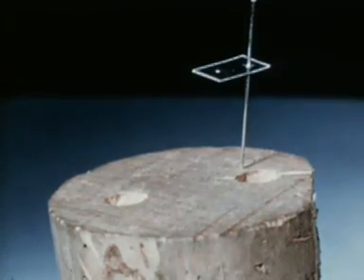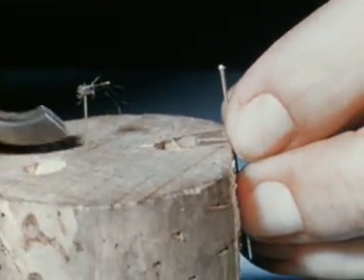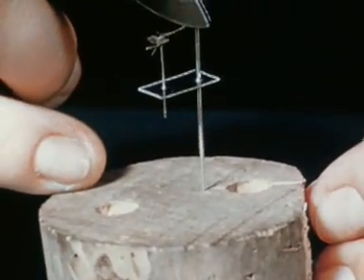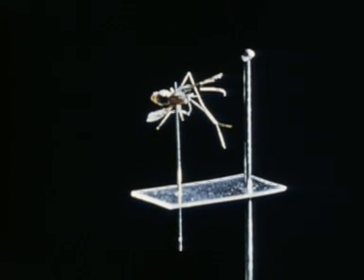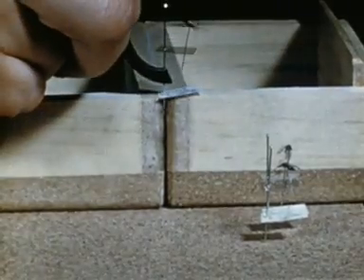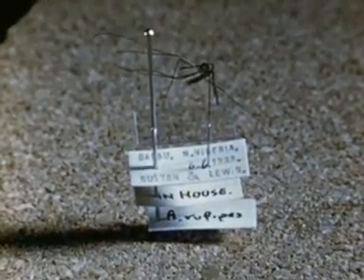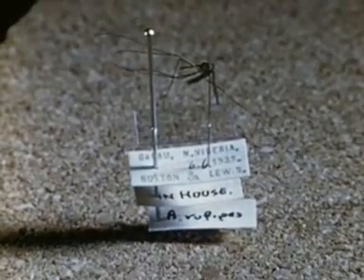For permanent storage, the pinned insect is then staged. For this, a piece of celluloid, 15x5mm, is used, already mounted on one of the large pins. The free end of the pin carrying the insect is inserted about 4mm from the edge of the celluloid, and the positions of the pins adjusted so that the mosquito is well below the top of the large pin. Labels are mounted on the large pin. They should be kept small, about the same size as the celluloid strip, and there may be several of them mounted one below the other. Usually, the top one gives the geographical locality, the date of collection, and the collector's name. The next one states where the insect was caught or where it was bred, and the bottom one gives the species — Anopheles rufipes, in this case.